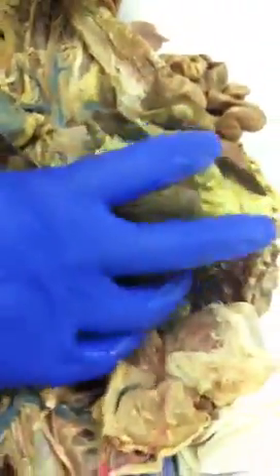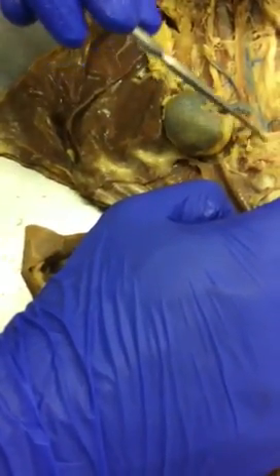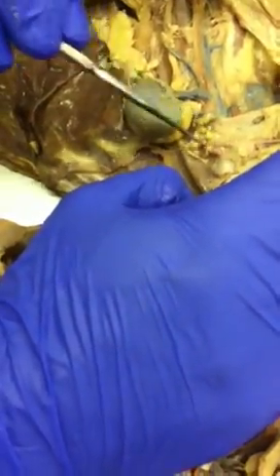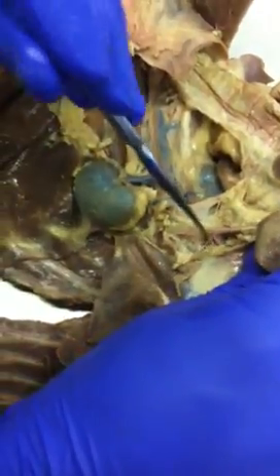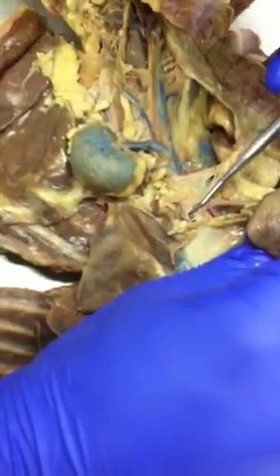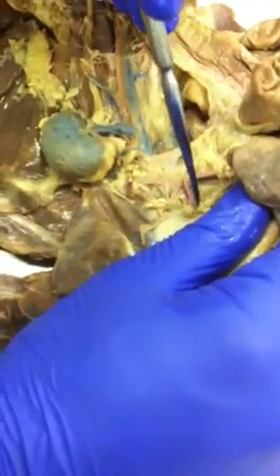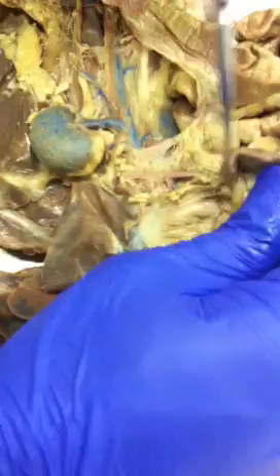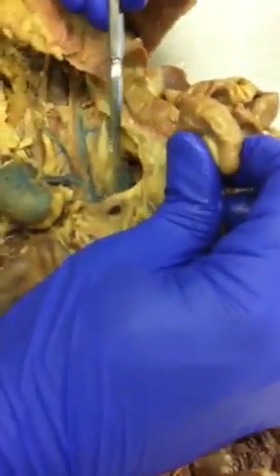Move down into the abdomen. You have the aorta under here. They're still kind of covered by some fat, but there's a branch point at this area too. So you have celiac trunk, and this is superior mesenteric. All right? So from the celiac trunk, it branches into a few different things. The first one is hepatic. This vessel goes back towards the liver. Then you have gastric. You can see them going straight into the stomach here. And then splenic, which goes all the way straight up into the spleen. And then again, superior mesenteric.